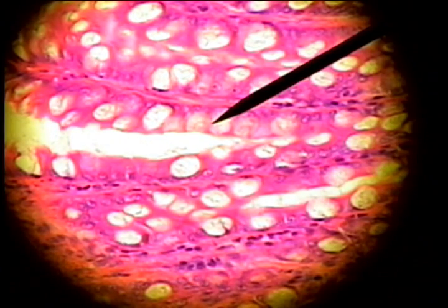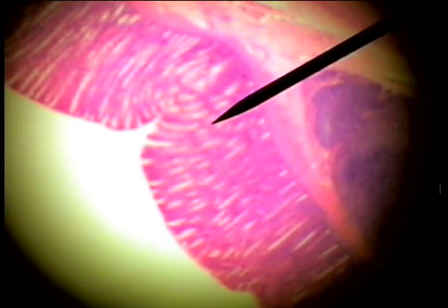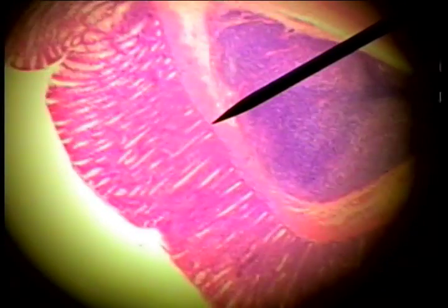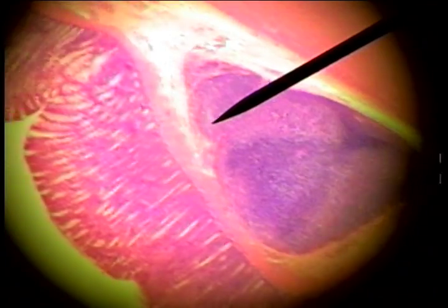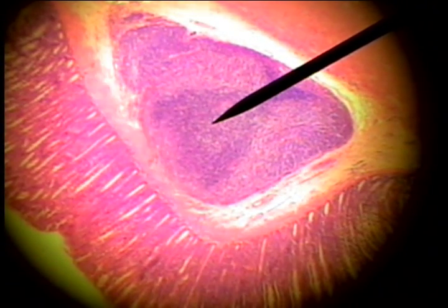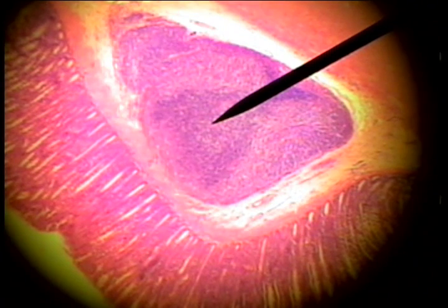Almost every other cell is a goblet cell, which is characteristic of the epithelium of the mucosa of the large intestine. Also, in the submucosa, you find the large lymphoid nodules in the large intestine.